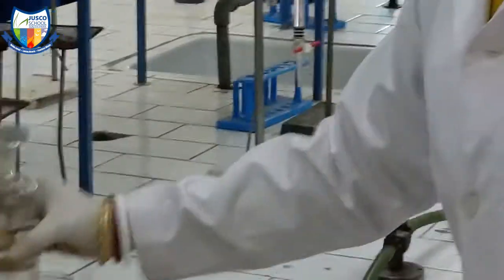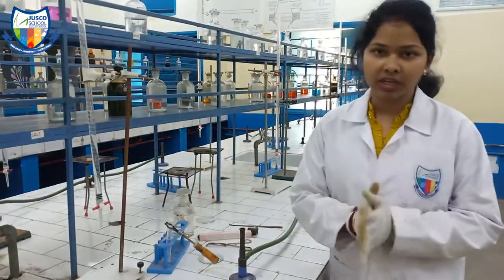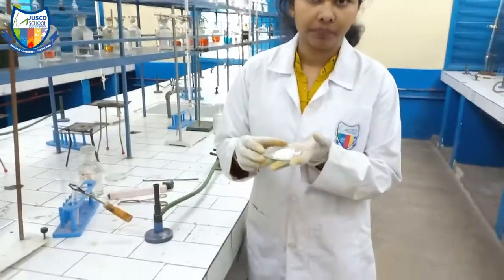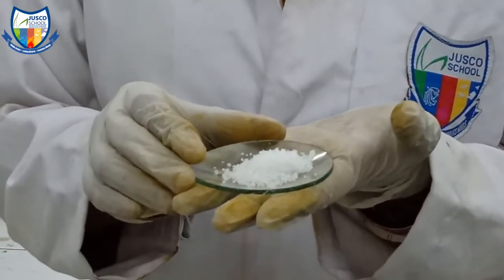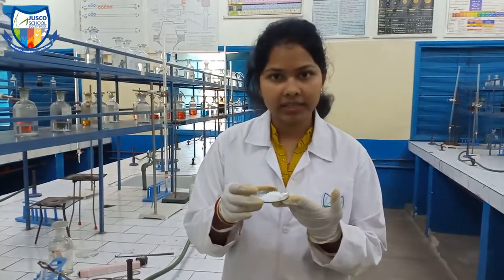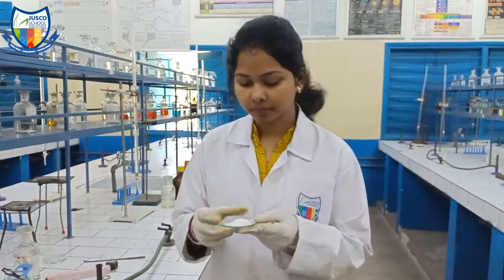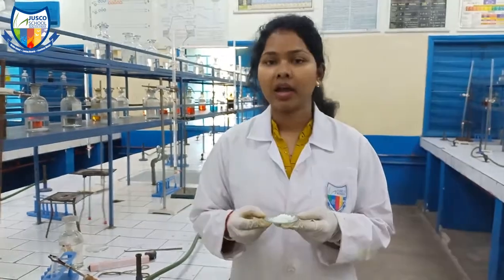Let's start the experiment with the preliminary test. Our first test is to examine the salt carefully — we will observe the colour and smell it. The colour is white and it is odourless. So the inference could be that it is calcium, magnesium, or aluminium.